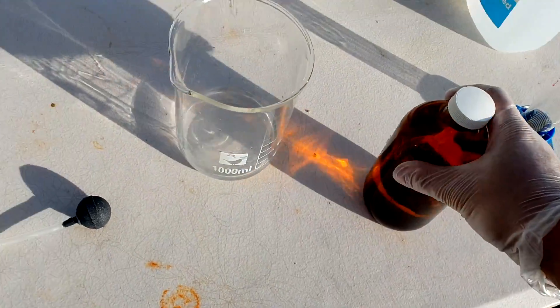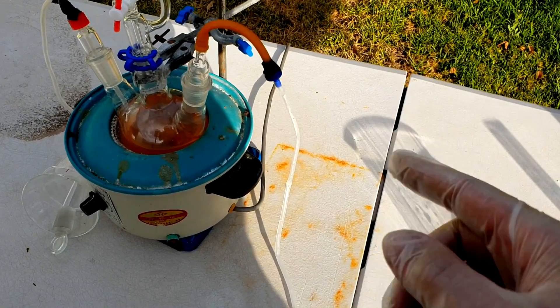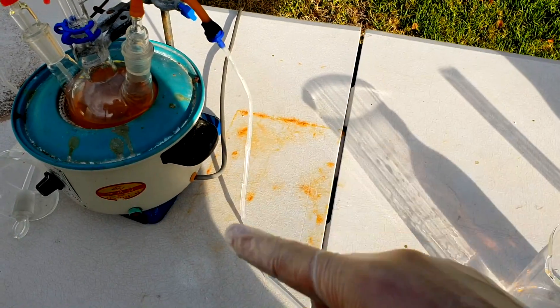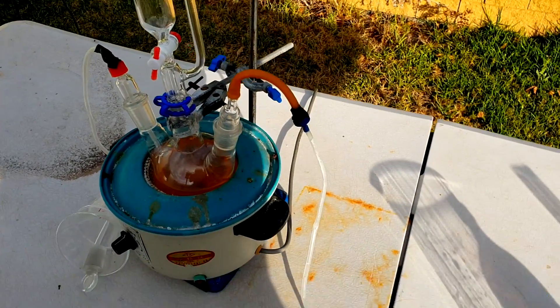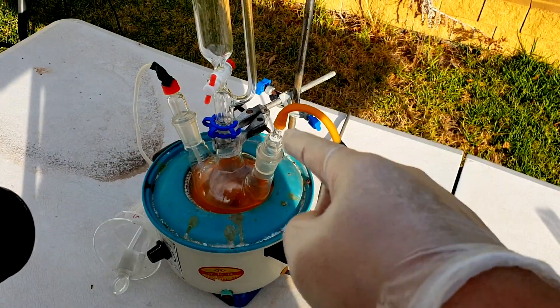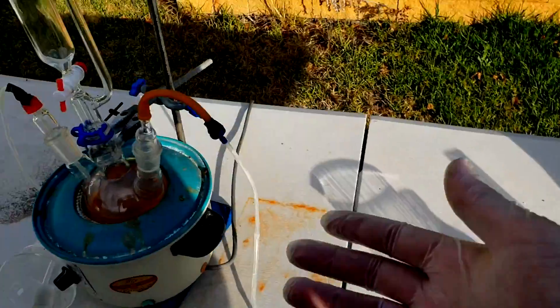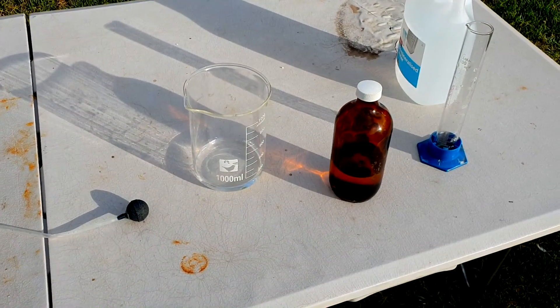That was pretty painless. Did the pump help? I think the pump helped, but it was harder to tell an end point, because usually with ammonia if it's bubbling through nicely, the bubbles will dissolve really easily, but then when it gets saturated you see the bubbles coming up to the surface — but of course with the air blowing through, you can't see that transition happen at all. The tape wasn't very good, but once again, usual thing from my videos. It worked well, and we didn't have any horrible suck-back, so I think using an aquarium pump has merit. I think it helped. Anyway, see you around for another video.